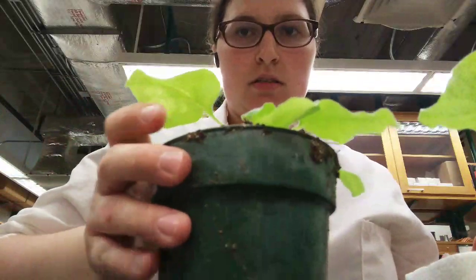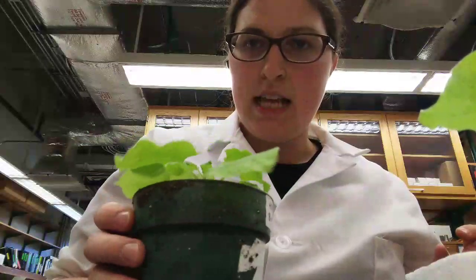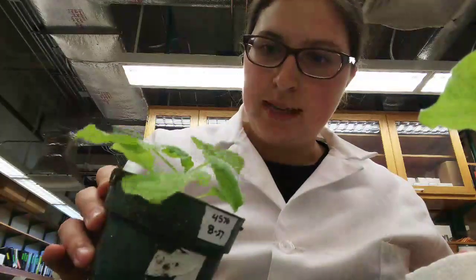And so right now I've done the first set. So this set is my protein just alone by itself, and we're going to look at that in about 48 hours-ish.